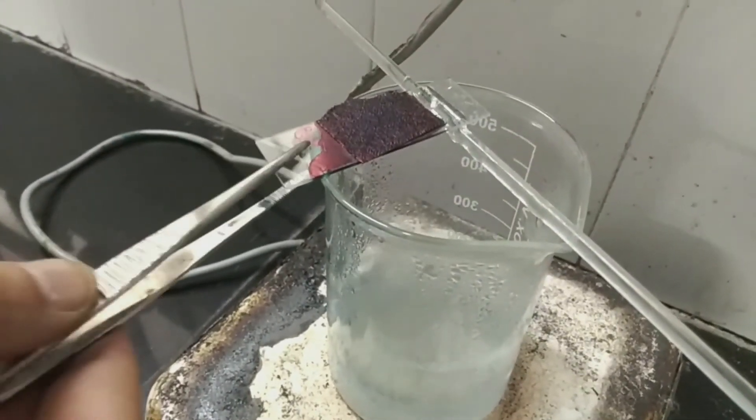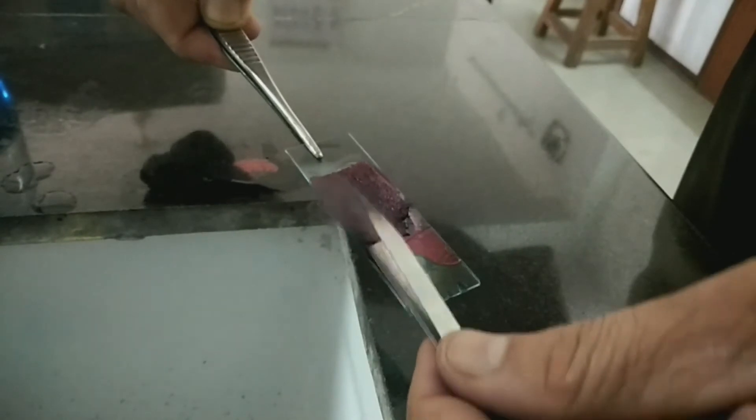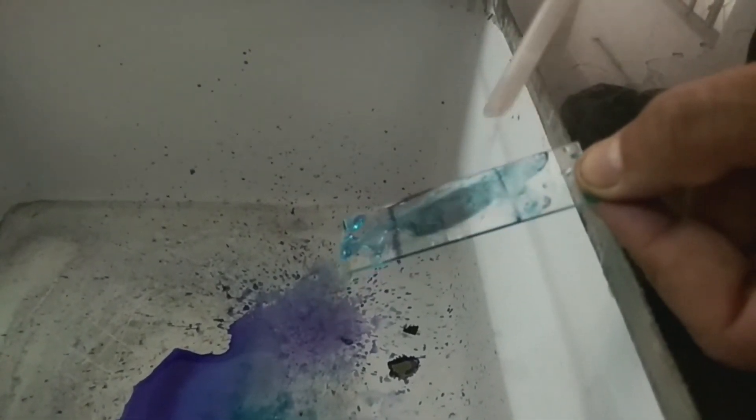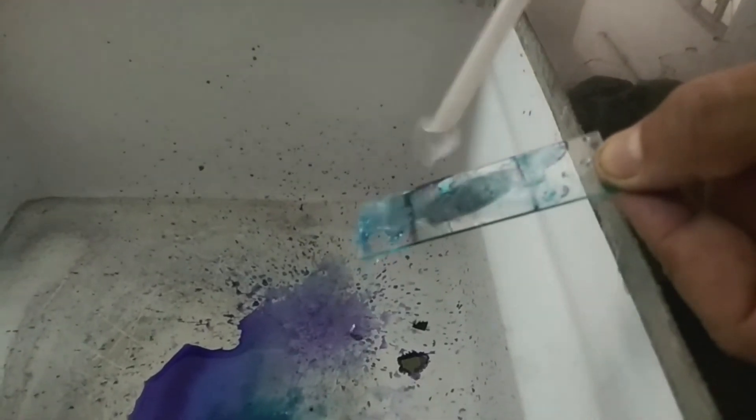After 5 to 10 minutes, take your slide away from the boiling water bath and remove the filter paper from the slide. After that, wash the smear carefully with distilled water and totally rinse out all the rest of malachite green from the slide.